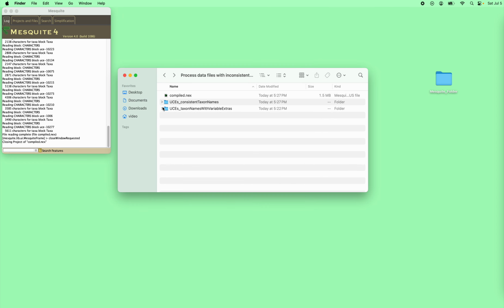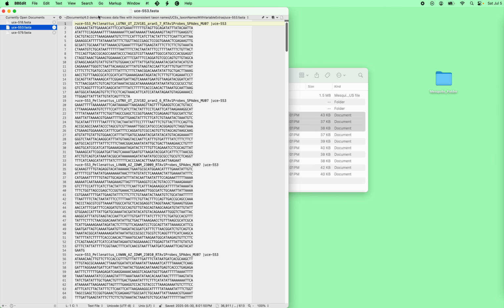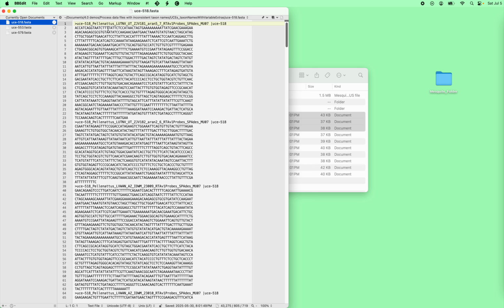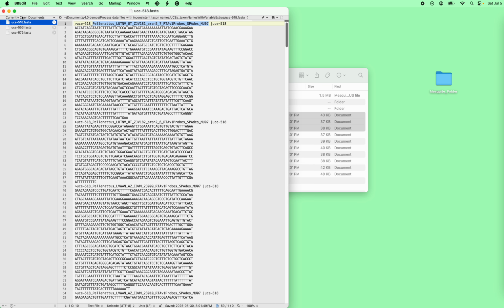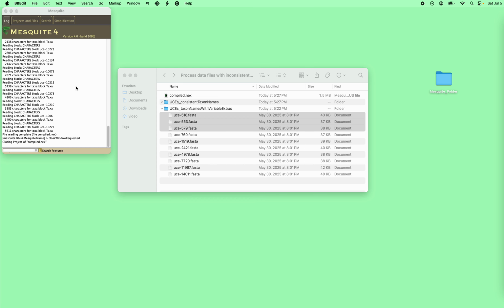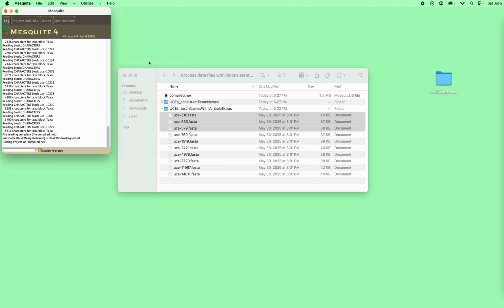The problem comes with the second one, because depending upon just how you've processed things, you may have a case like this, where the taxon names from one locus to another are inconsistent because they have the UCEs embedded within the taxon names. What we really want is just this bit from there to there, not with the UCE numbers, here 518, here 553. If Mesquite were to try to read all these and compile them, it wouldn't necessarily know that this is the same taxon as that, because it looks different superficially. But if we tell Mesquite that it's supposed to be processing the taxon names as they come in, it can get around that. So in this case, we're going to do process data files.